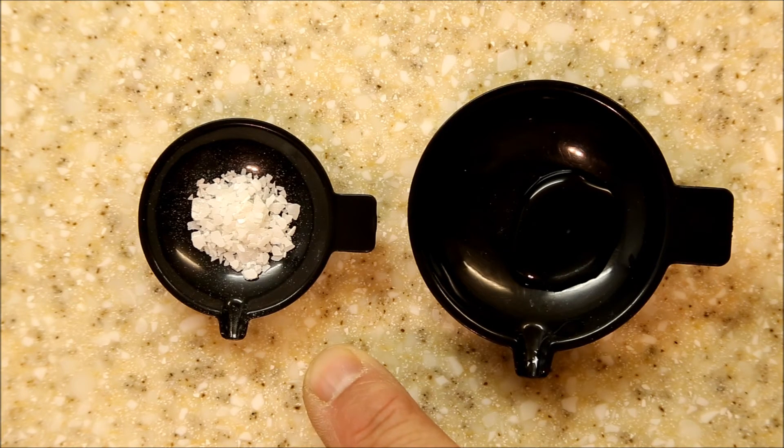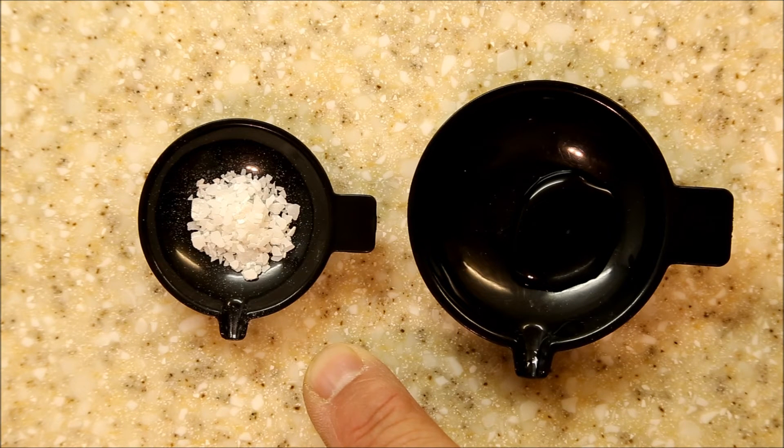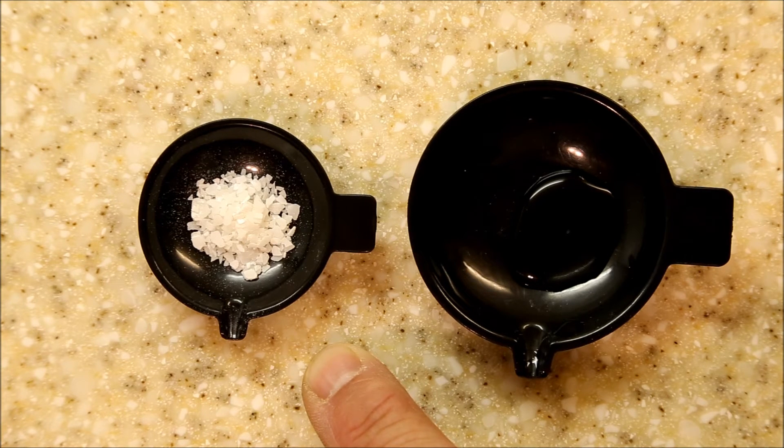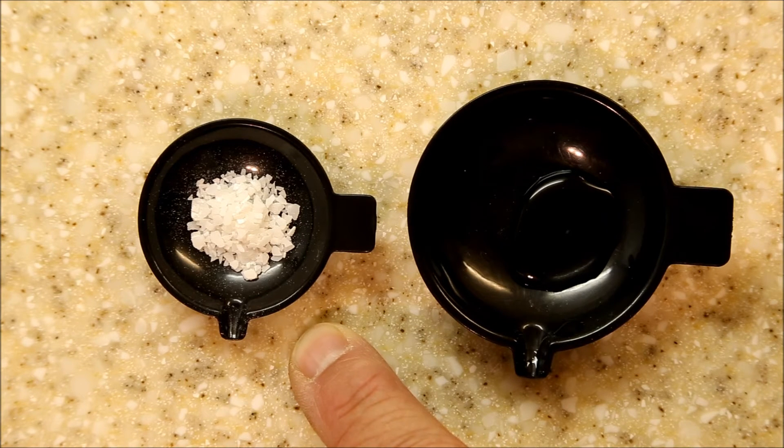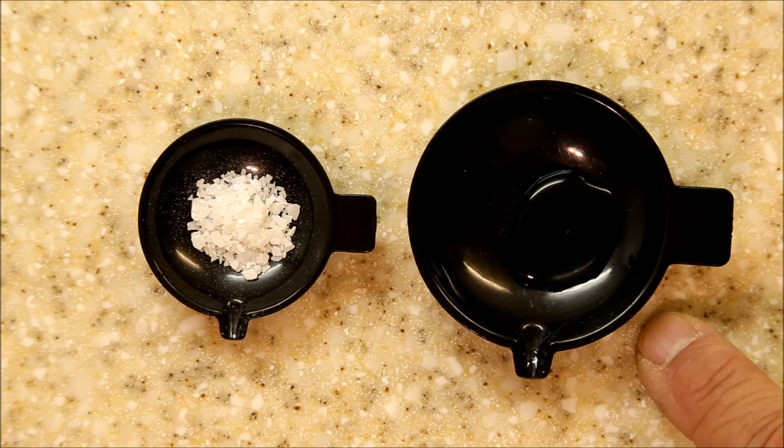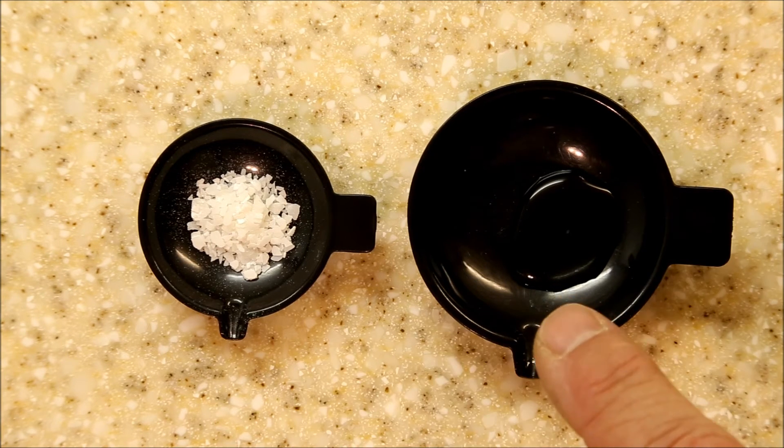For my system, which uses the liquid spread out over a two inch by three inch rectangle, I found the best quantity was obtained by mixing one and a half grams of the stannous chloride with one and a half grams of distilled water.